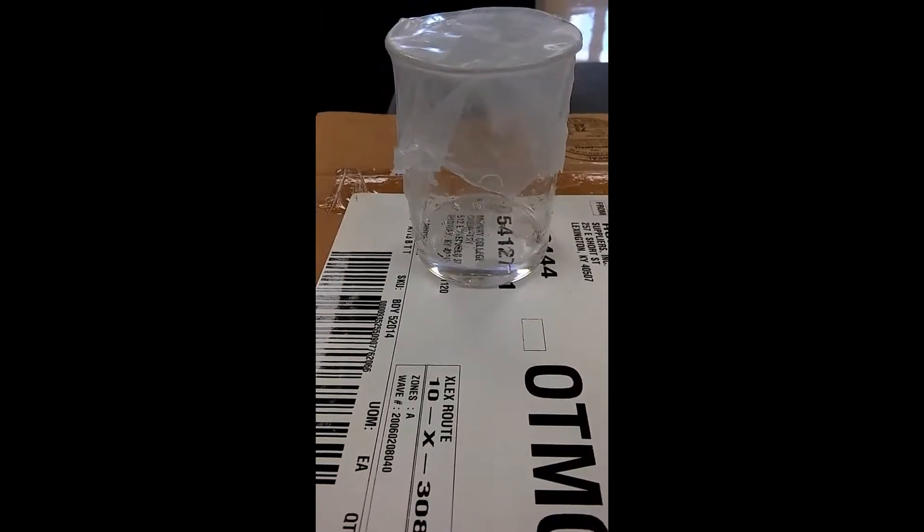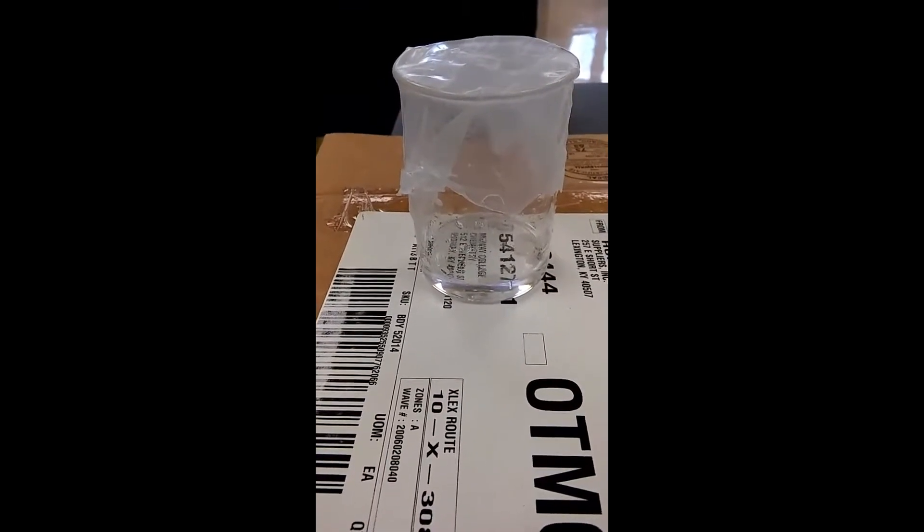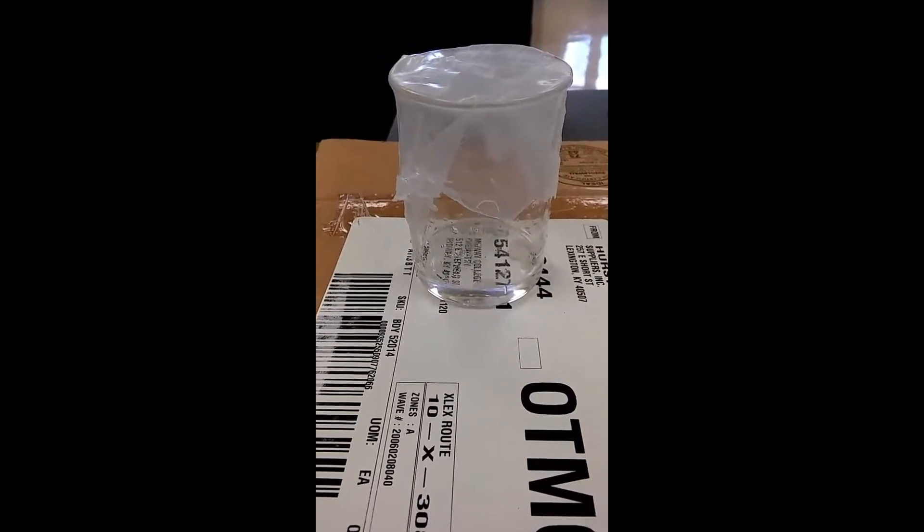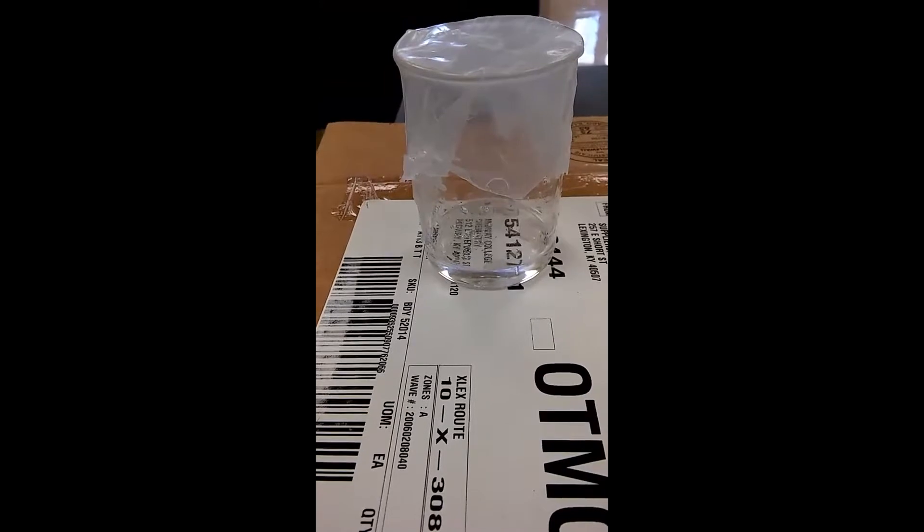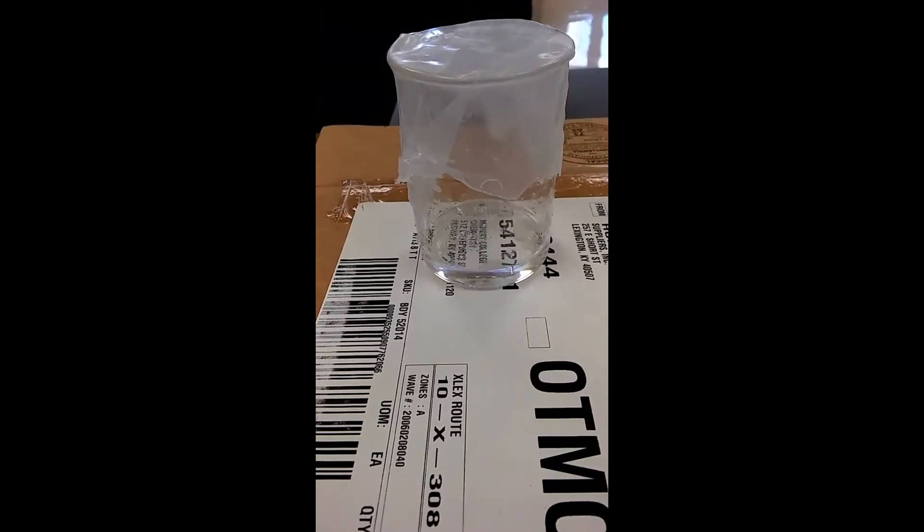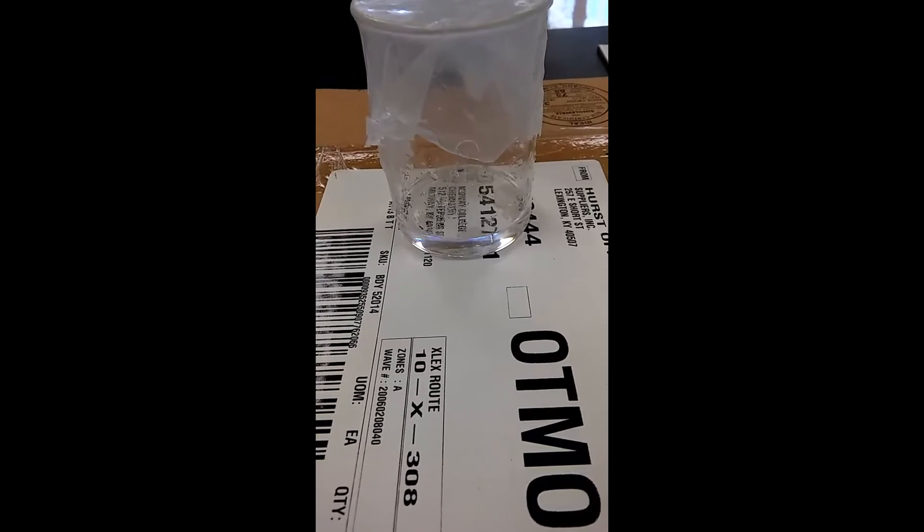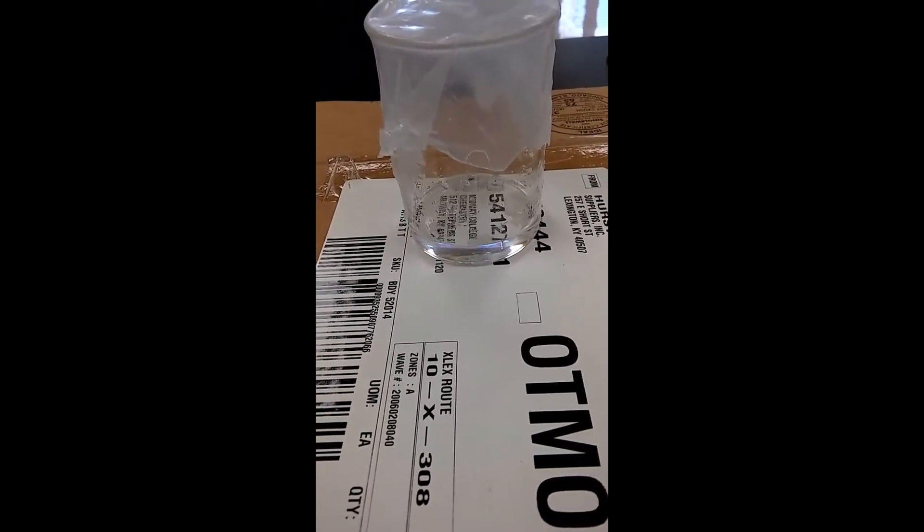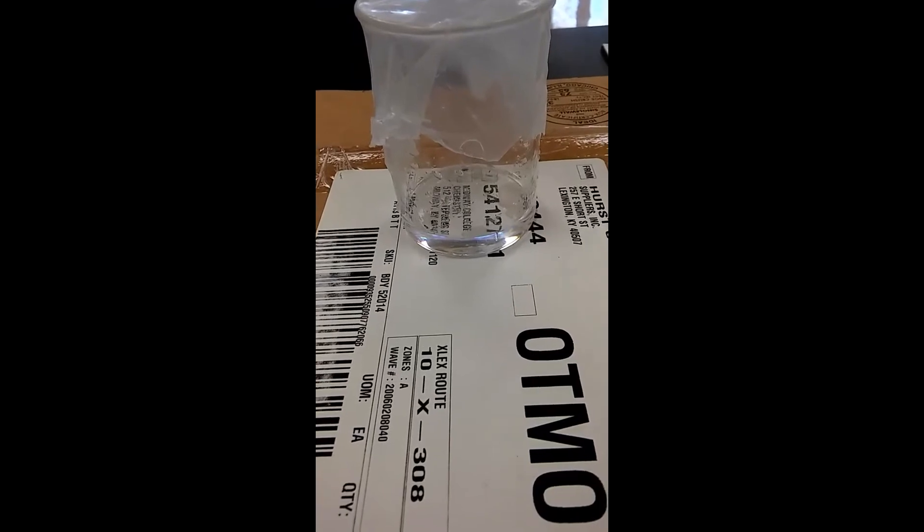I'm going to put it in the fridge, and if phenol is in there it should crystallize. It should have already crystallized, so I don't know if it's not enough temperature here. So I'm going to put it in the fridge and give it a shot after a day. If not, we're going to recrystallize, and hopefully this is what our students would also be doing - they get the initial distillate and then they can come back in the next class period and re-distillate it to get the purest of the pure phenol. Now I did spill a little bit of this on the tray as I was removing it, so I probably lost a couple of grams. I cleaned it up so the station's not dirty. But I got everything that was in here. This looks pretty clean. No contamination whatsoever. So I'm going to put it in the fridge and I'll see you all in a day.